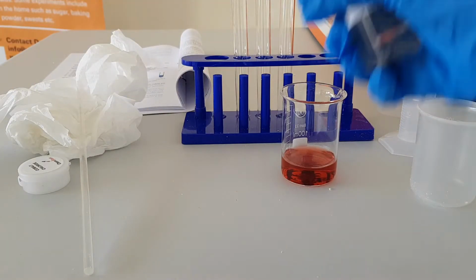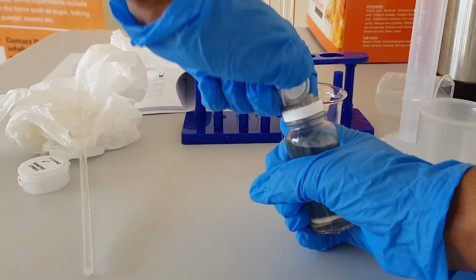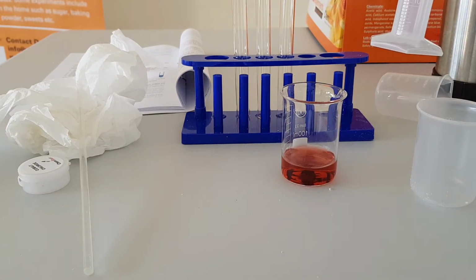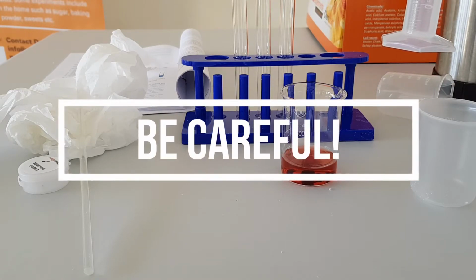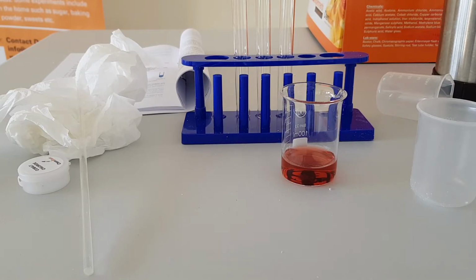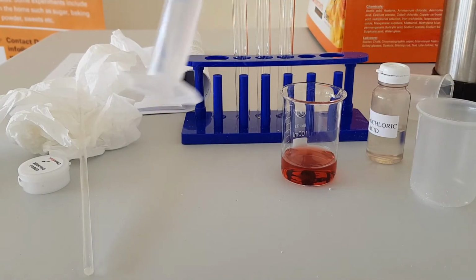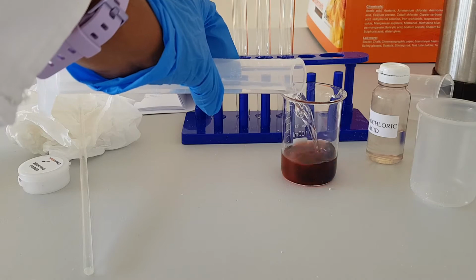And then you add 25 ml of hydrochloric acid. Now this is concentrated hydrochloric acid, so it has some fumes which you need to avoid breathing. And we add this into the chloride solution.